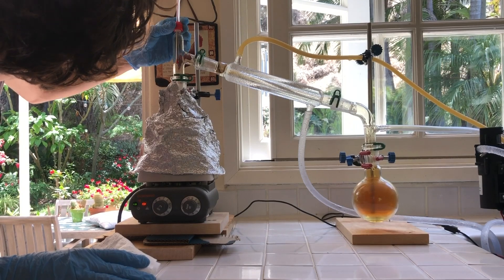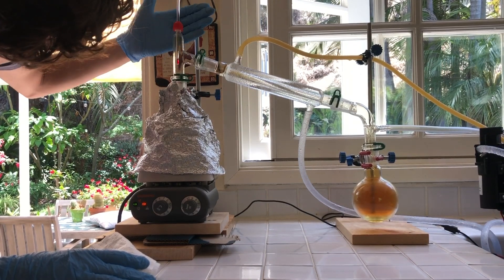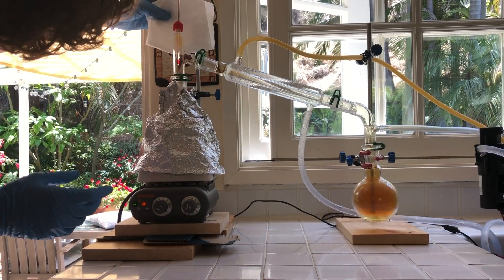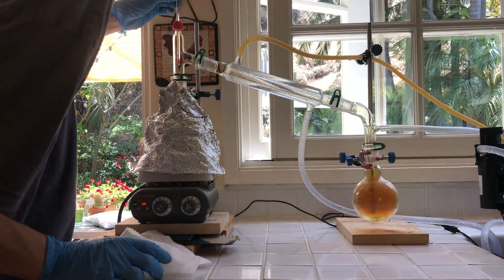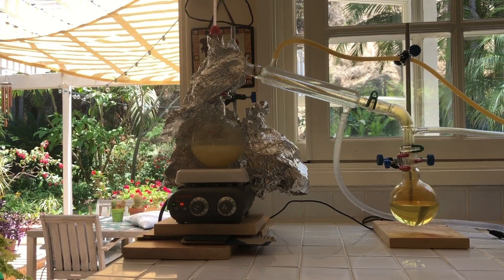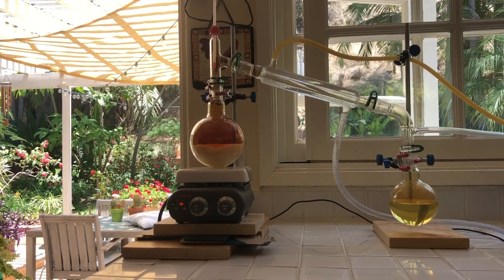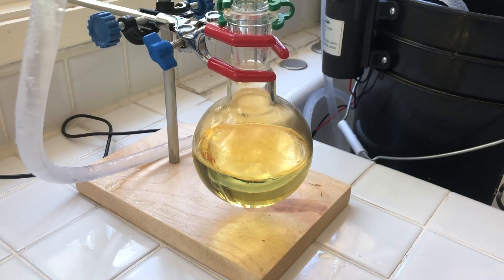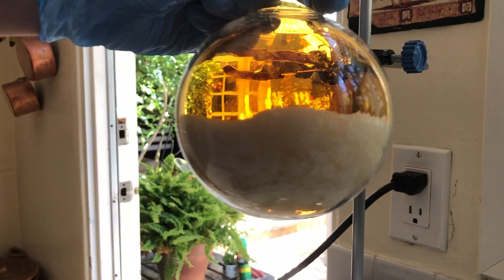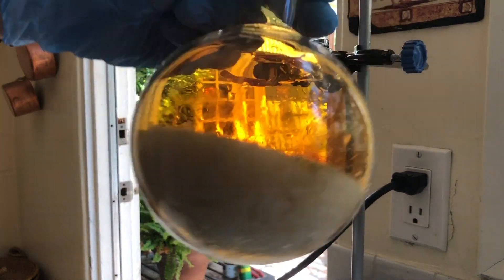Unfortunately, something went wrong with my thermometer adapter and it kept loosening itself, which made me freak out a little bit. However, I didn't see any gas leaking, so I just kept tightening it often. Near the end of the distillation, the potassium bisulfate began falling out of solution, and the nitrogen dioxide gas got even darker. I was left with what looked like about 150 ml of yellow distillate, and a hard mass of potassium bisulfate crystals in my boiling flask.